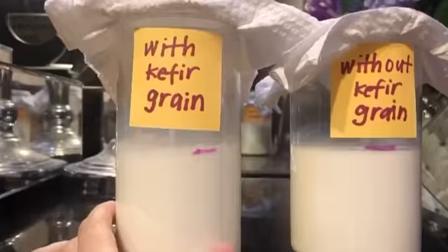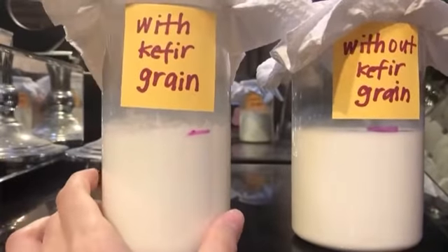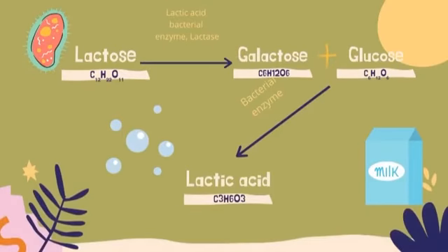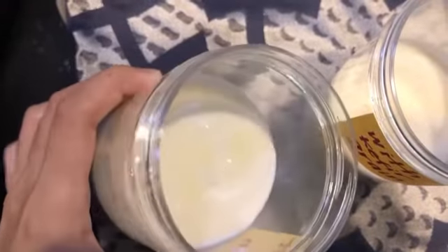As we can see from here, the milk with kefir grains is much more viscous than the milk without kefir grains. This is the fermentation equation that happens in a lactic acid fermentation inside milk. There are proofs that this equation happened in this experiment.